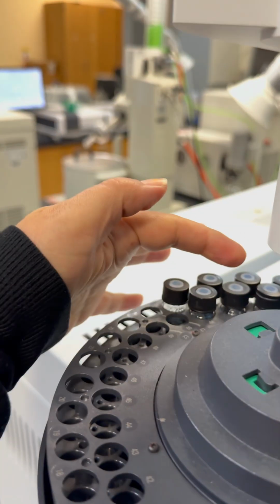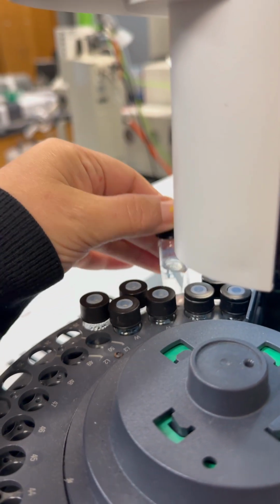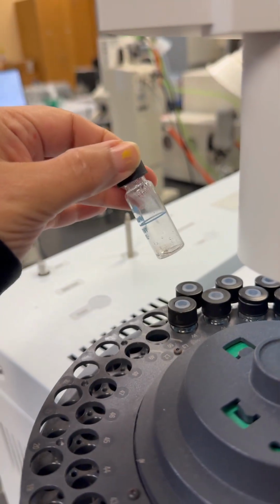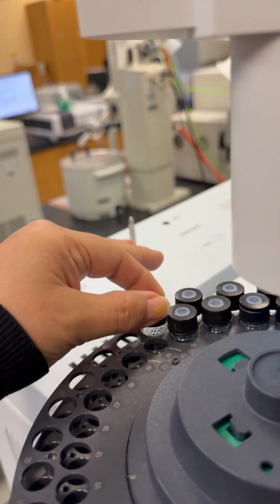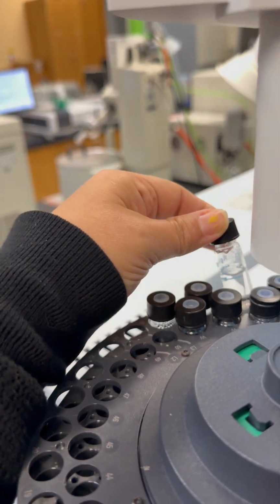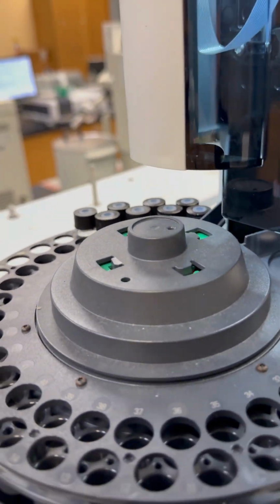These are basically in the back. There are four. The first ones are the four alcohols. We use a solvent, methanol actually. And here, when the column is washed and the syringe is washed, it's going to put the waste here. So you should always make sure the first four are half full up to the line, and the end one should always be empty, not more than half full.